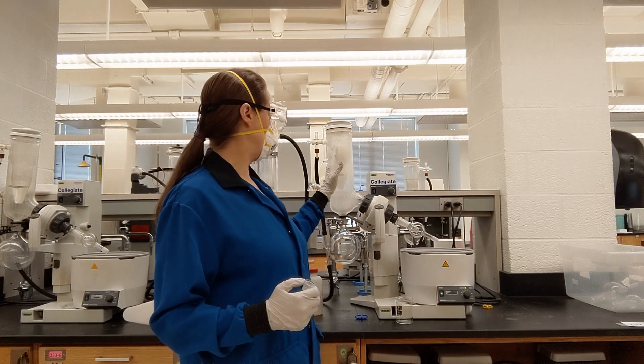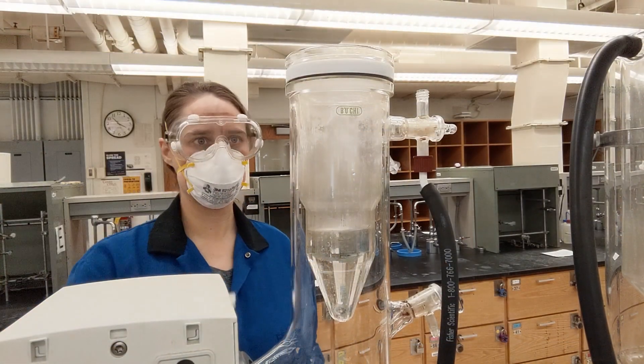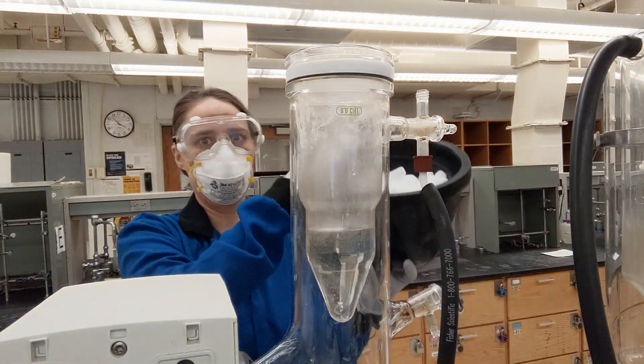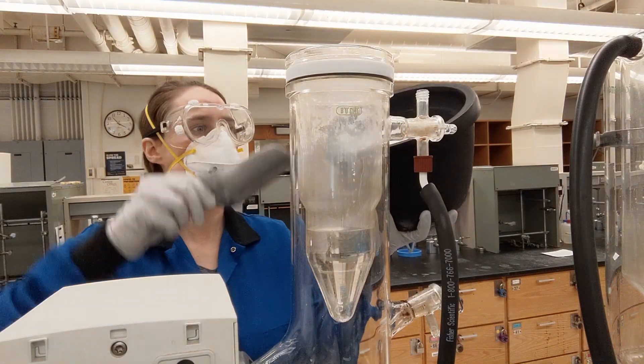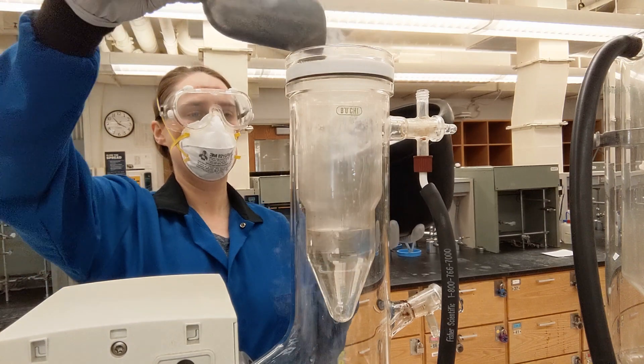You are also going to want to put something cold inside the inner container here. There's an outer container and an inner container. The way I'm using it, it's a mixture of acetone and dry ice, because that should be at a constant temperature of negative 78 degrees Celsius.